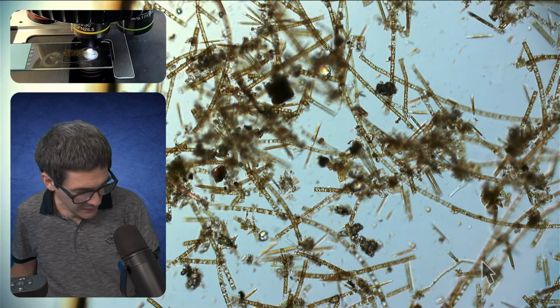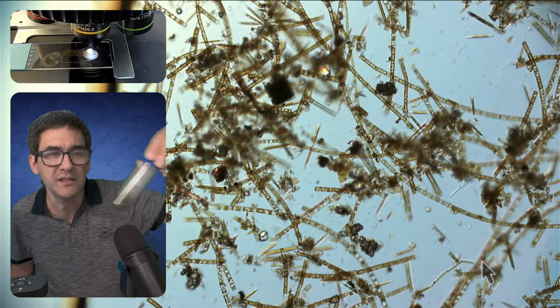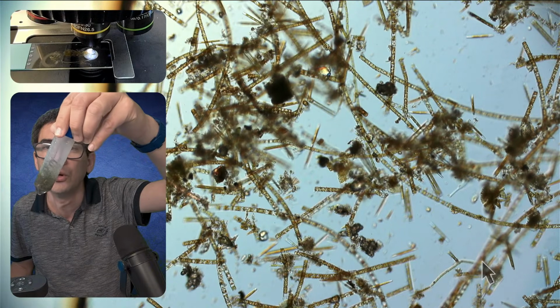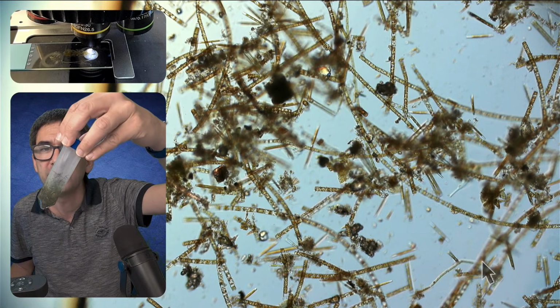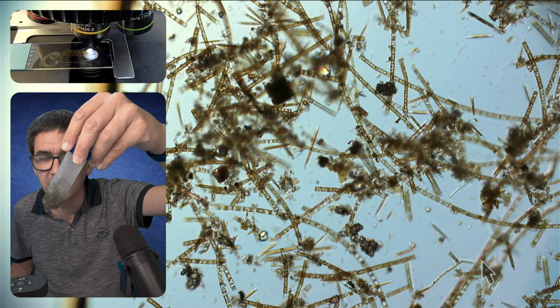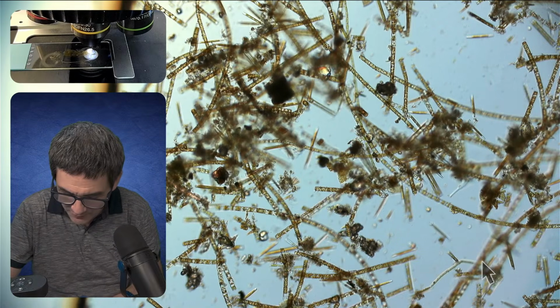Yeah, so that's the one. And now there's another water sample, and this is basically the moss. I collected some moss from the side, and I don't know if this one actually is that revealing or not. We're just going to try this as well. So what I'm going to do is take some of this stuff out here.